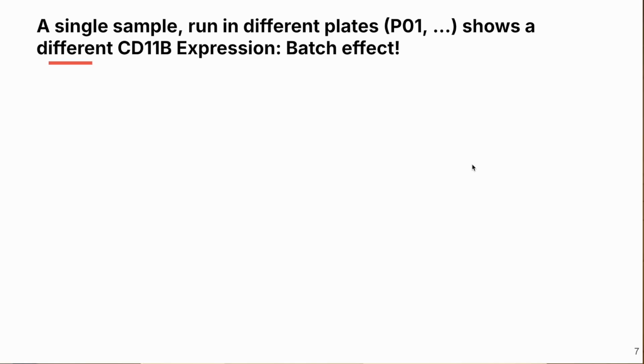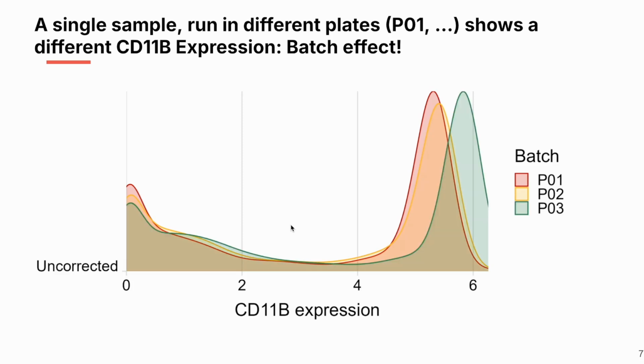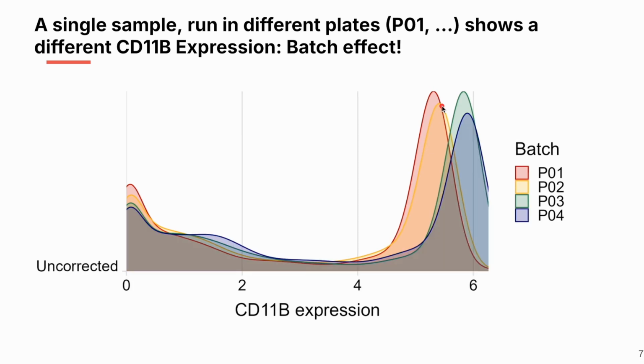So let's take an example. This is a single sample run in 4 different plates. P01, you're going to see the notation, and we're going to look at CD11B expression. You're going to see this real-life batch effect. So here's a single sample with CD11B expression on the x-axis. This is called a ridgeline plot. Basically, it's like a histogram, and this sums to 1 across all these expression levels. This is an uncorrected value. Now, we are going to run the same exact sample in another batch, and this is P02, and it's not exactly lined up. And then P03, and you can see this green line isn't lined up as it was in the first 2 cases, and then P04. So this same sample shows different expression patterns. It's the exact same sample. So this is what's called a batch effect, when the very same sample is showing these results that are all over the place.